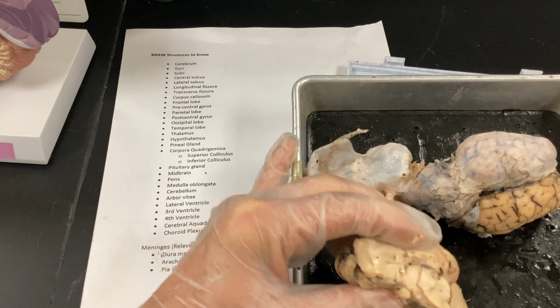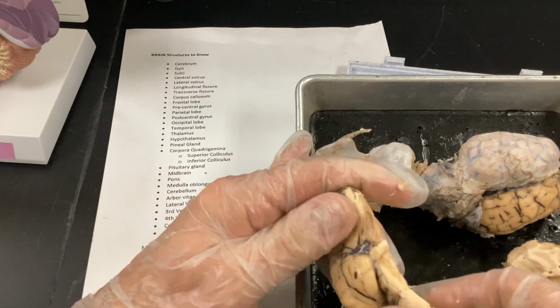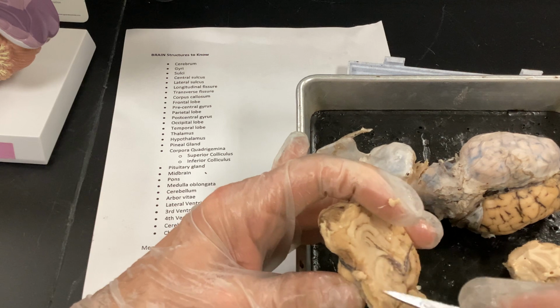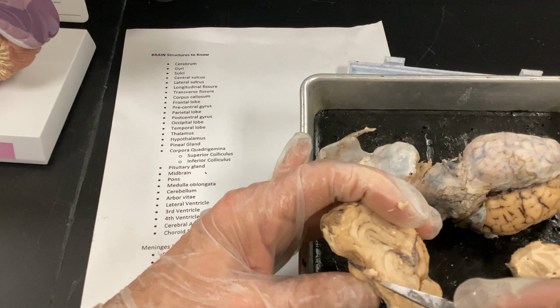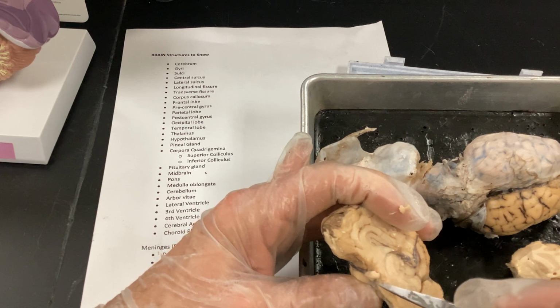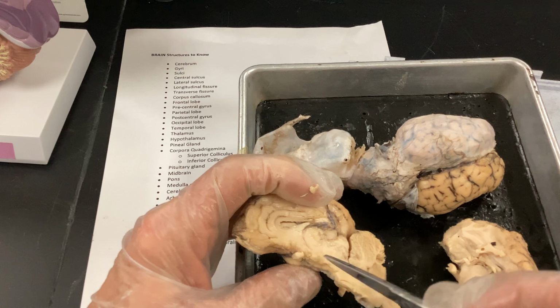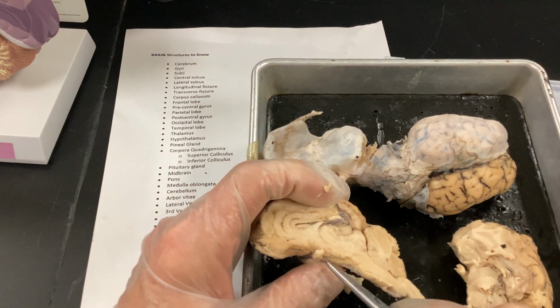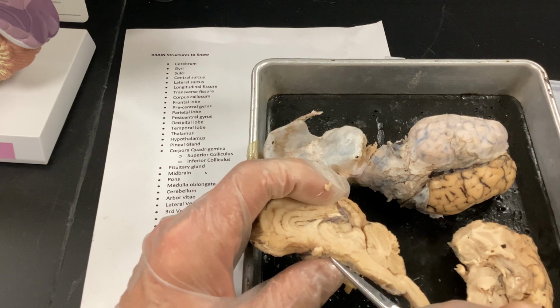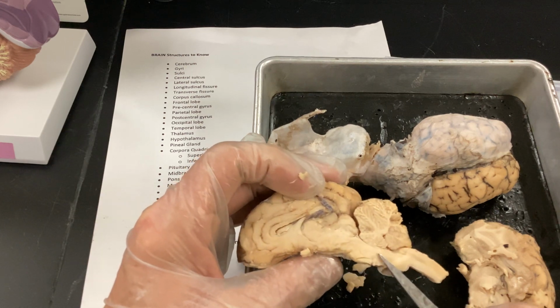Pituitary gland, maybe I'll grab this section. That one looks like it's been, all right, pituitary gland should be right where the optic chiasm is. And you'll probably see it on a model better, but the pituitary gland is going to be hanging off the infundibulum, right around the optic chiasm. And, lights are out. Hold on. And the pituitary gland is there. There's an anterior and posterior portion, which is part of your endocrine system. That should be one of the first things they talk about in A&P 2 once you get past this. All right. Midbrain is going to be in that area there.